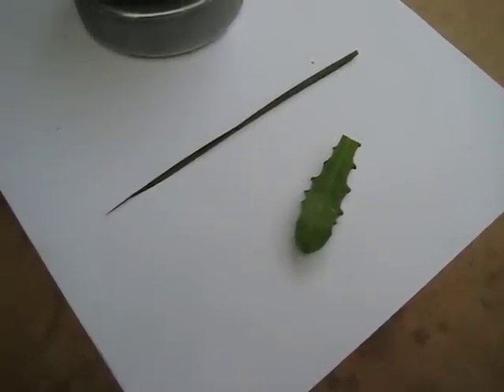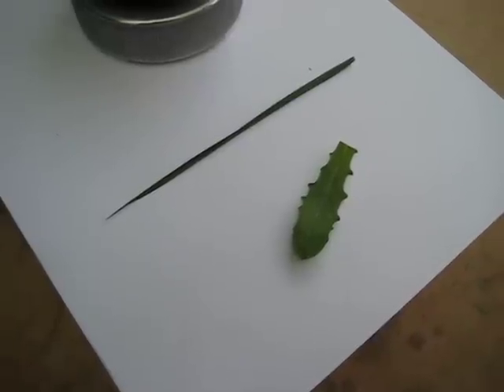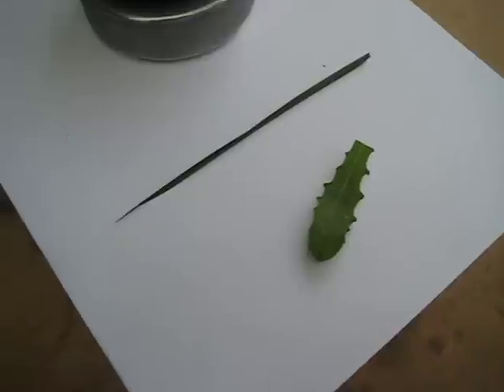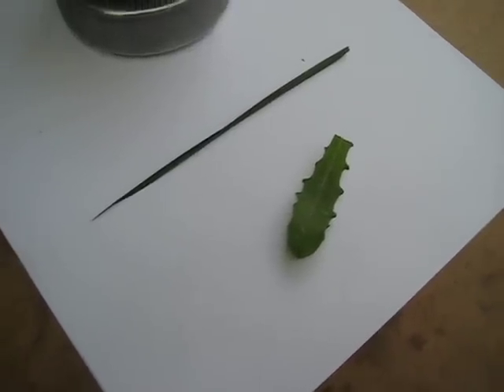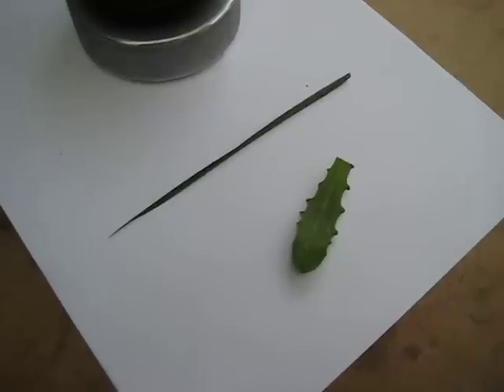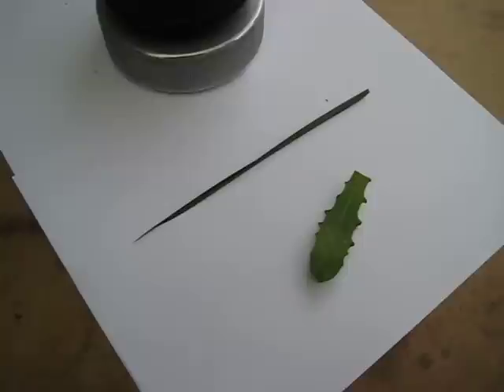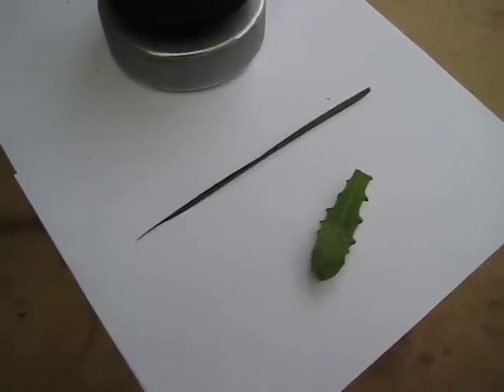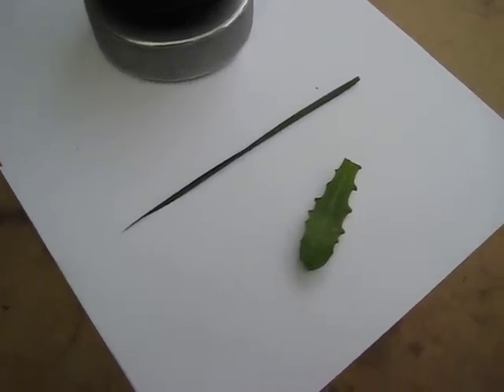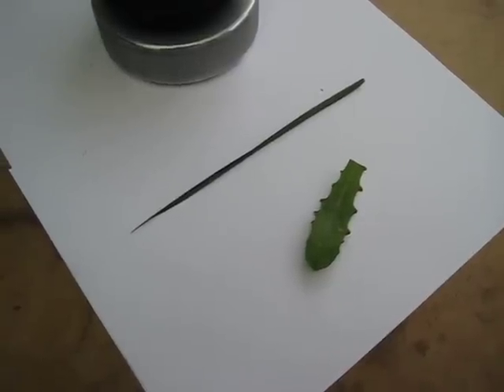This is a tutorial on sealing bladed grass in the grass compression gland. We get two samples of grass that can be sealed — bladed type samples. This seal would work good with any type of wide bladed grass, weed, or young corn blades.